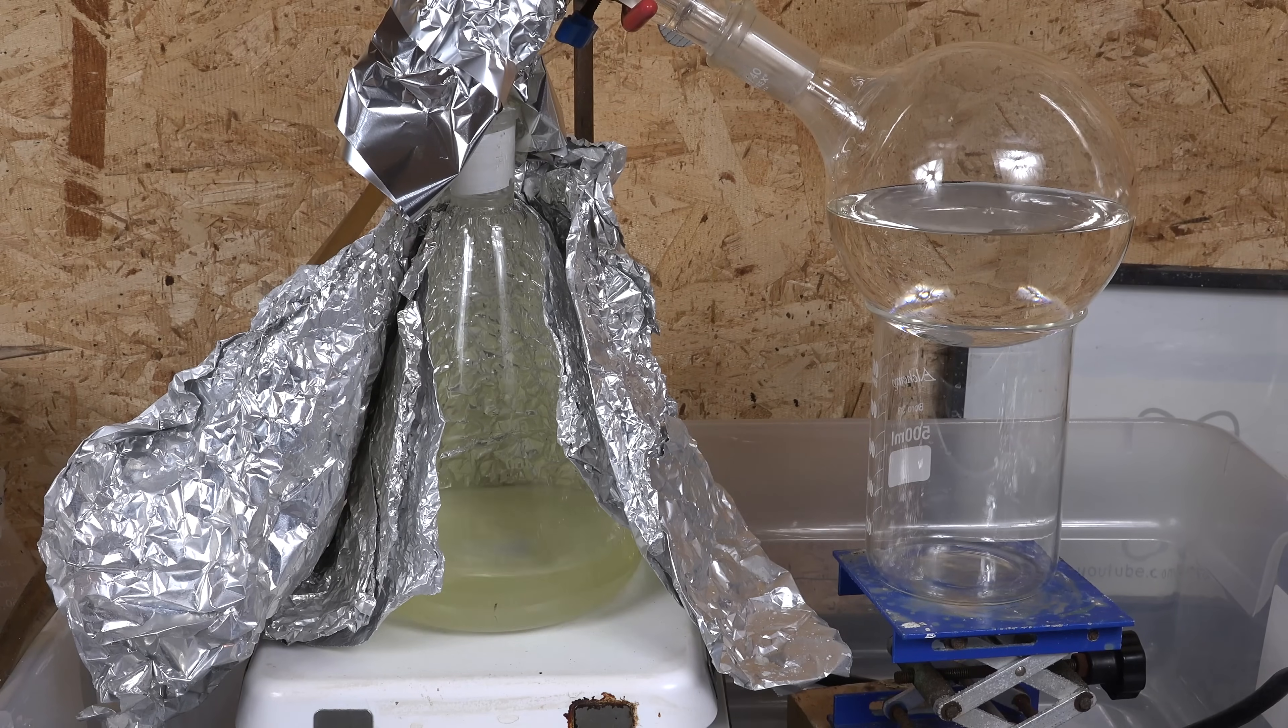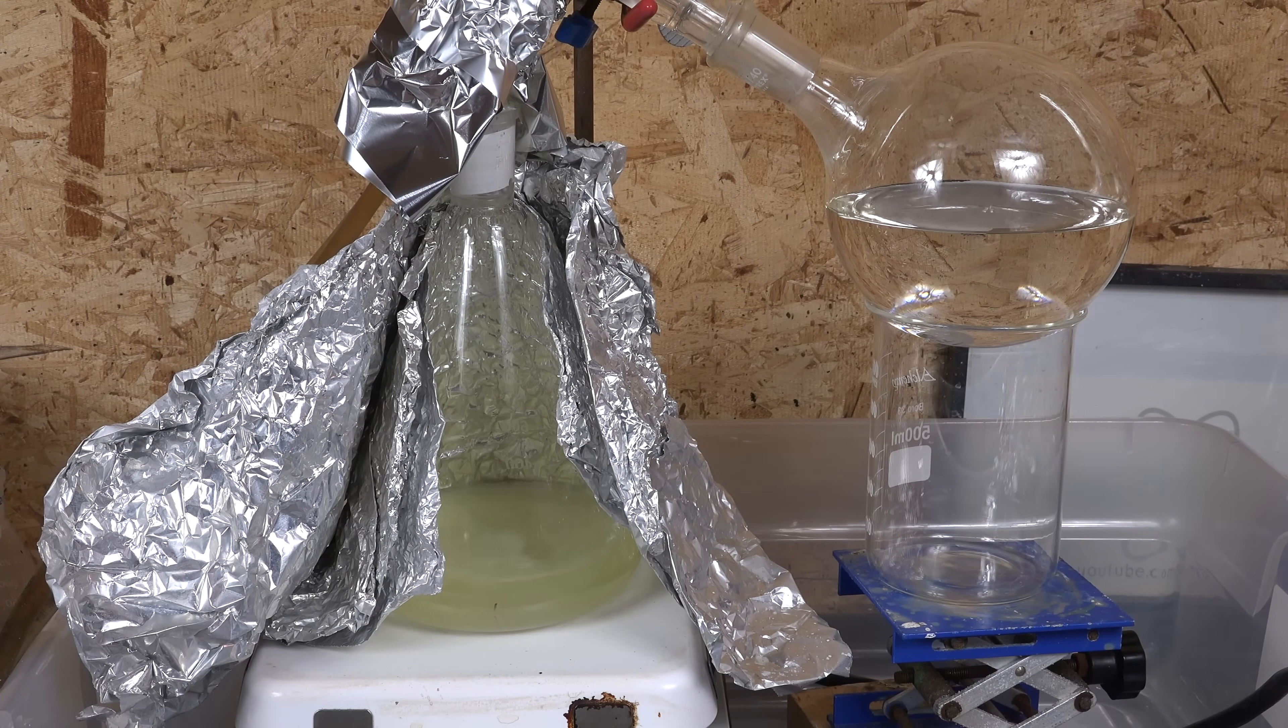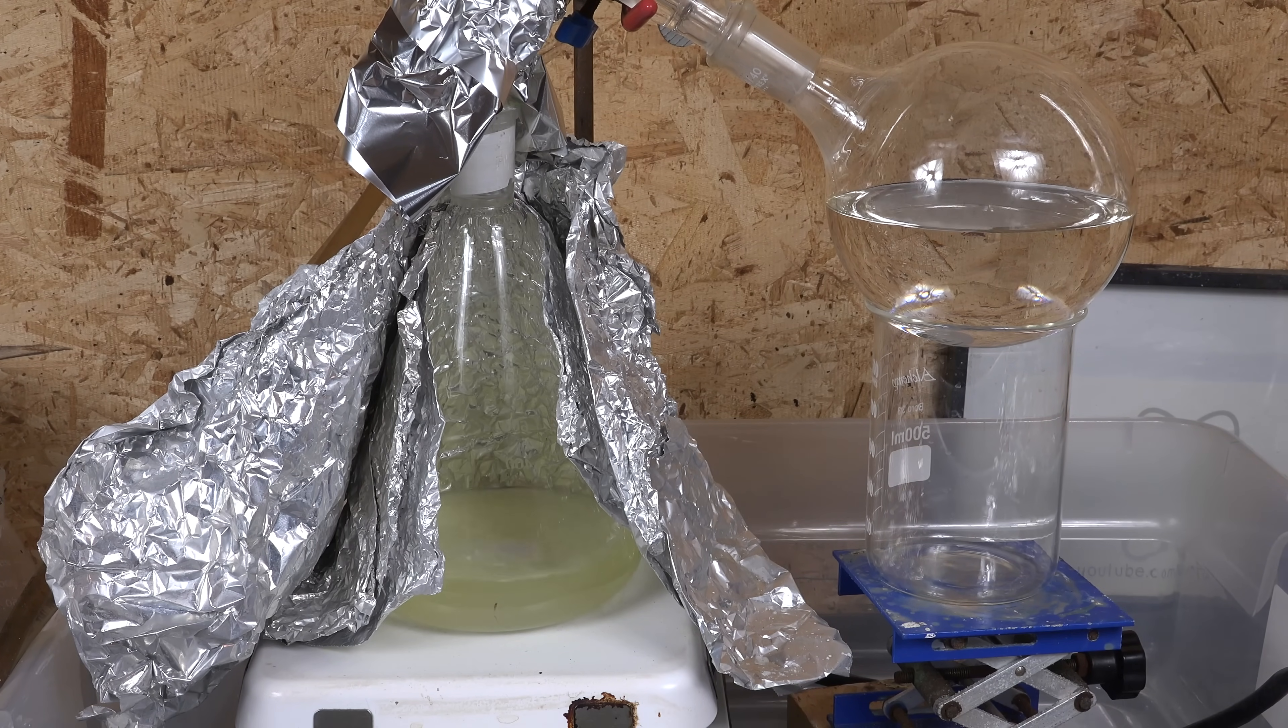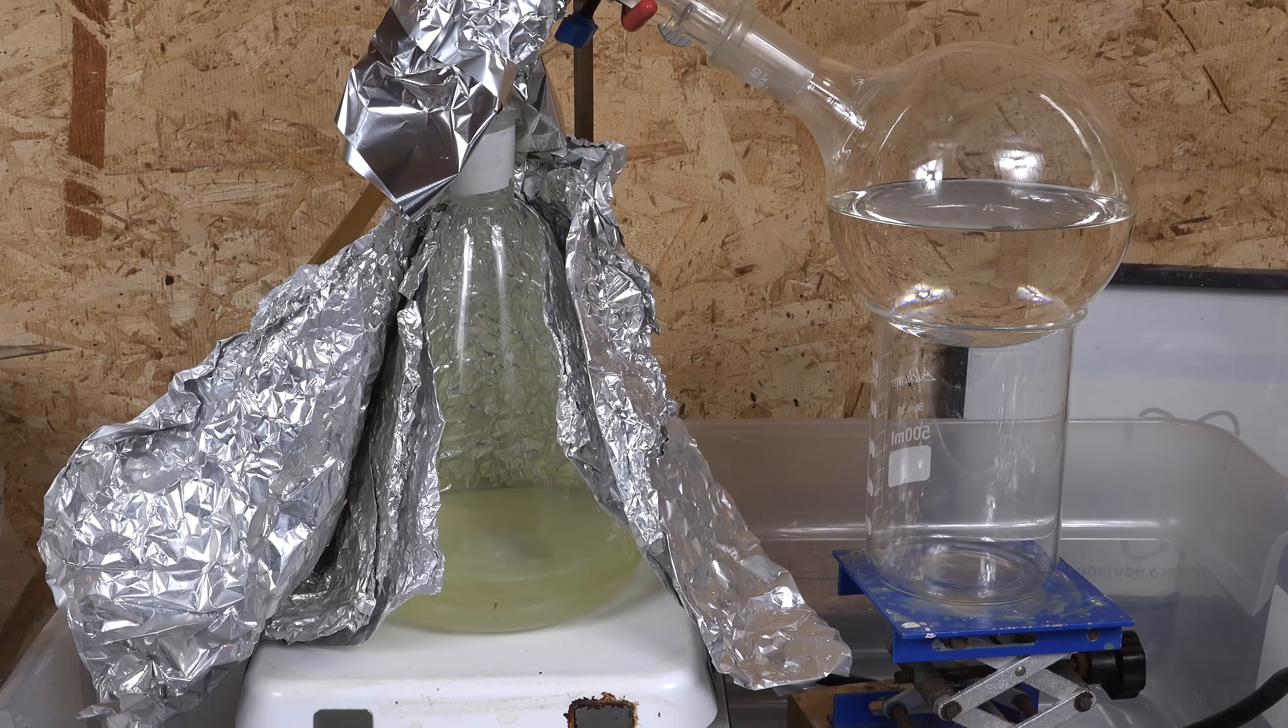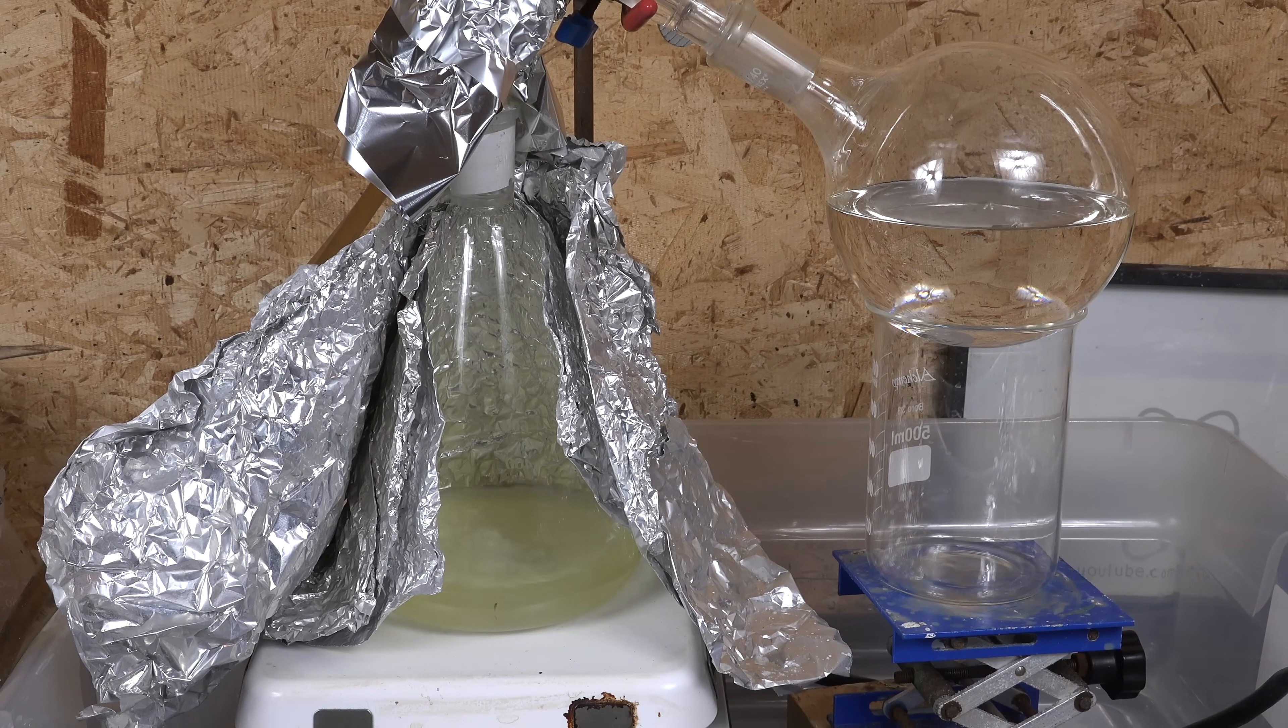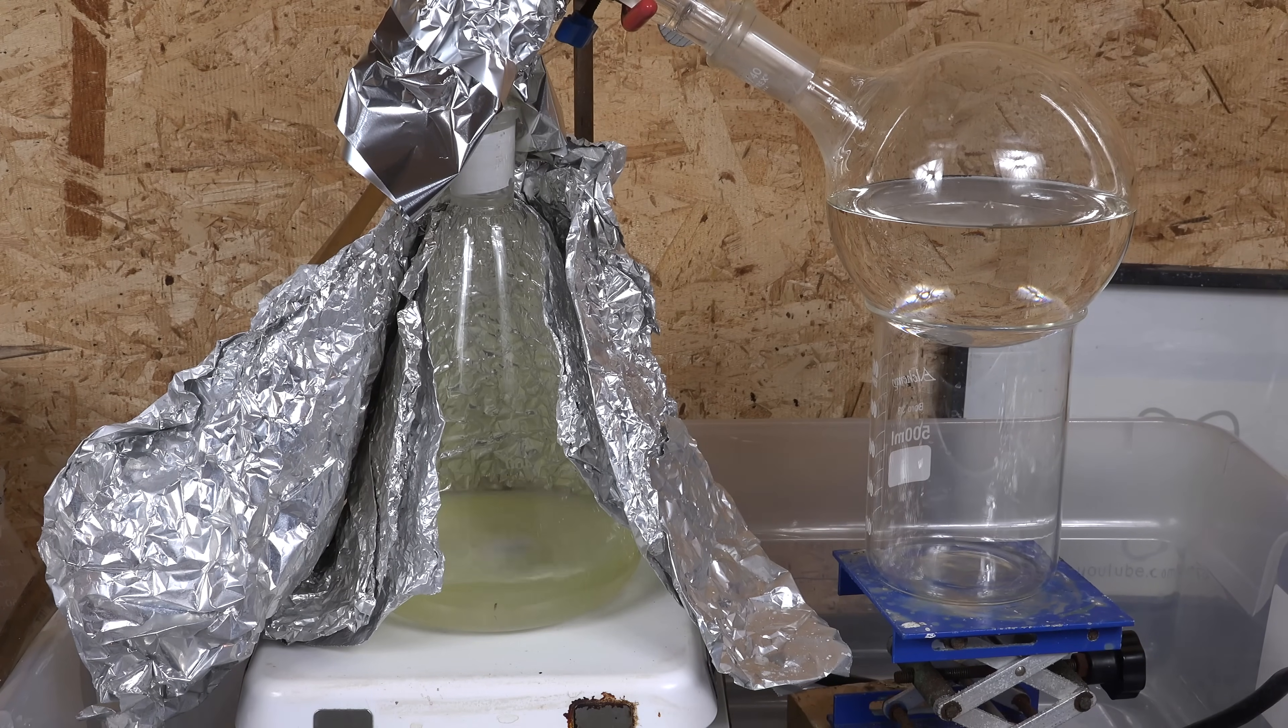So let's move on from the doom and gloom safety talk and discuss some of the other aspects of the experiment. You might be wondering how the stir bar survives such insanely corrosive conditions. The stir bar is a PTFE or teflon coated magnetic stir bar. PTFE is one of the few substances that is chemically immune to boiling sulfuric acid.